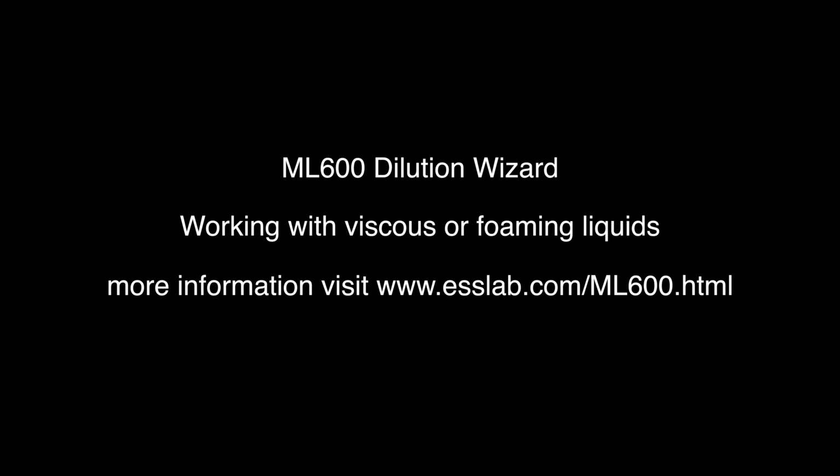and you'll note that difference when we're dispensing. Because I don't want to have so many problems with foaming, what we're looking at here is changing the dispense speeds, particularly of our reagents and the sample. So we're going to change both on the dispense side to the lower rates. Here we're going to change that to 1250 microliters per second as a slightly slower speed, and also change this to the slower speed again.